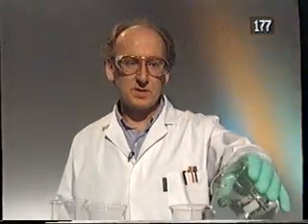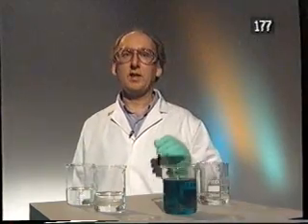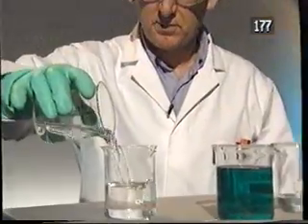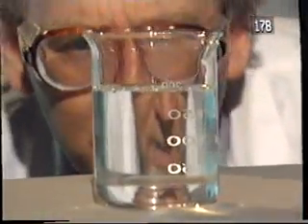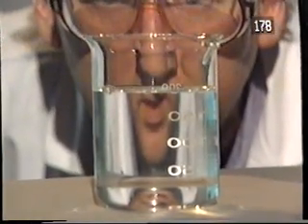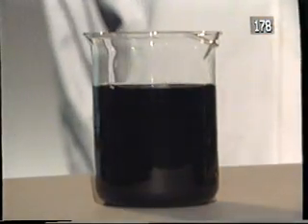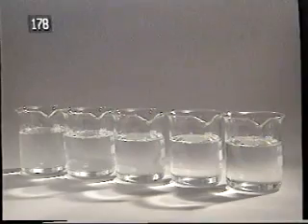Most of the reactions we've seen so far happen instantaneously. For example, when I added the base to the red compound from cabbage, it instantly went green. Have a look at this reaction. It's a slow reaction. Nothing much seems to happen at first, but the reaction carries on until it reaches a critical point and then goes blue. And the time taken for the blue colour to appear reflects how fast the reaction occurs.